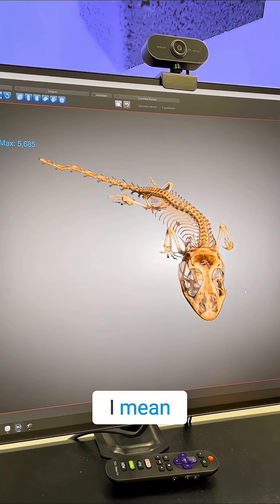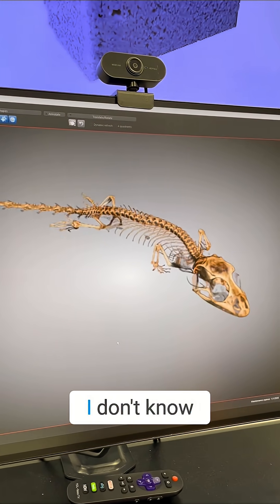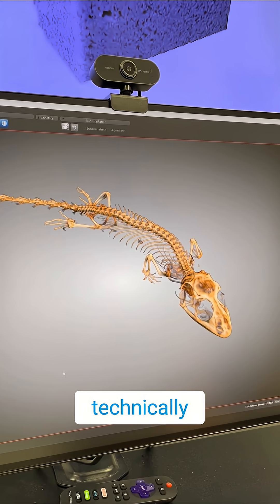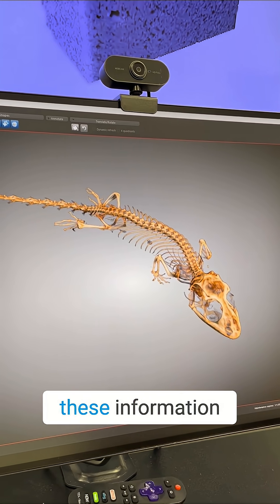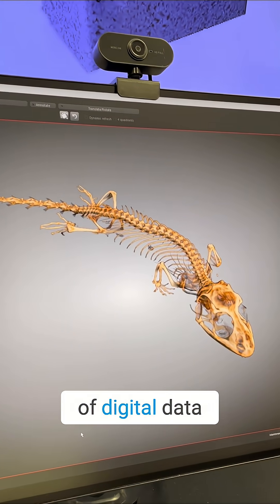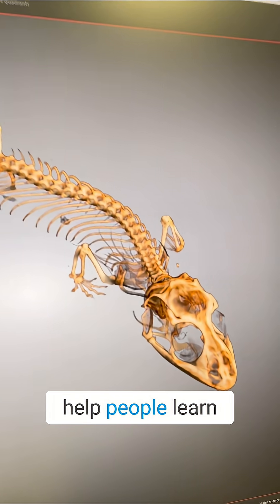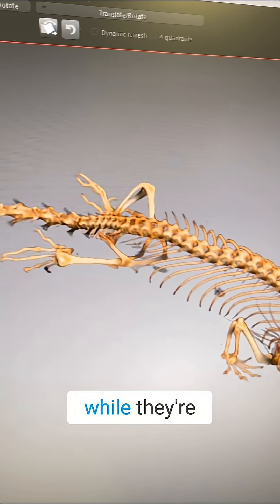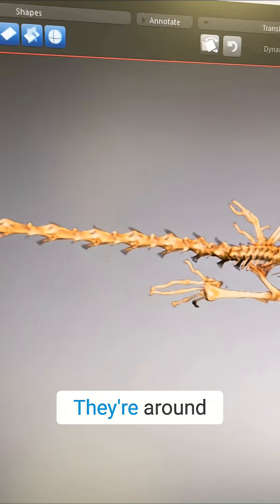I mean, are they really that related? They're technically dinosaurs, right? These data are very valuable because digital data like this can help people learn about these things while they're away from you, around the world.